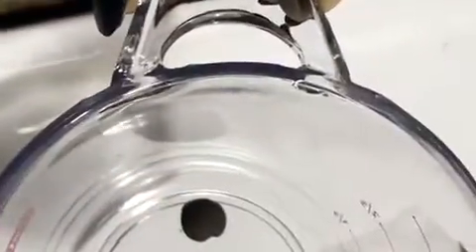For the first method, we have to line up our soil samples in pea-sized balls. This is what I have done. We have this, which is from the tilled field, and then we have this, which is from the wooded area.